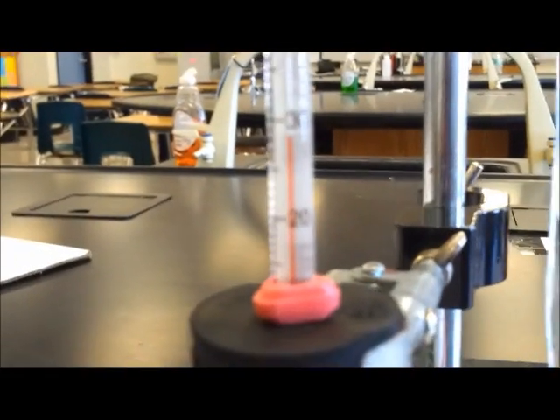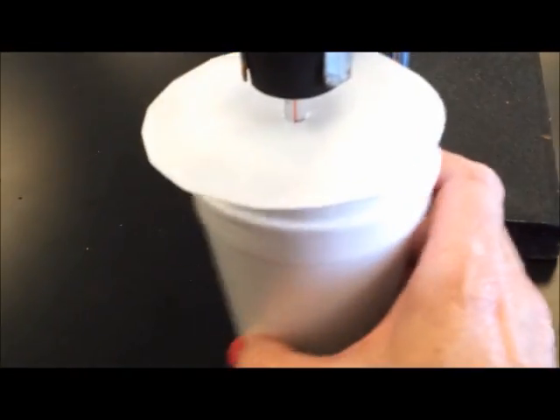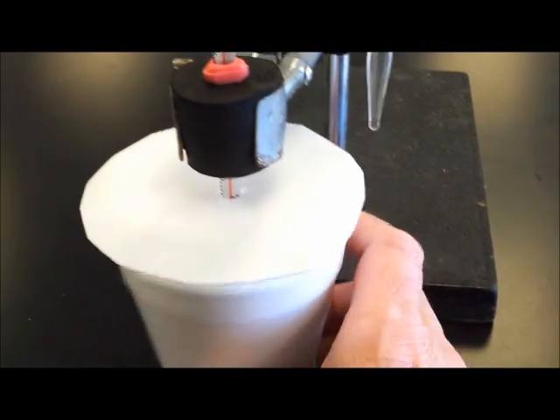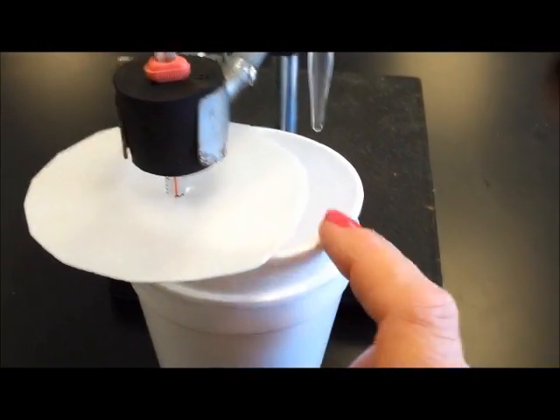And every single time we make a measurement, then we are going to add more acid. That is going to take between one or two minutes in between each measurement.